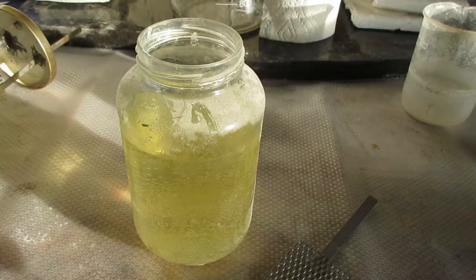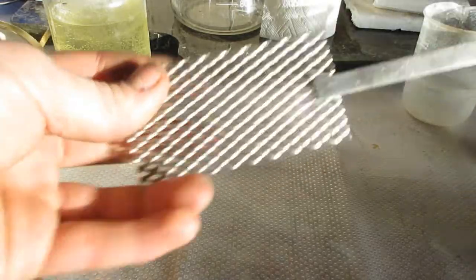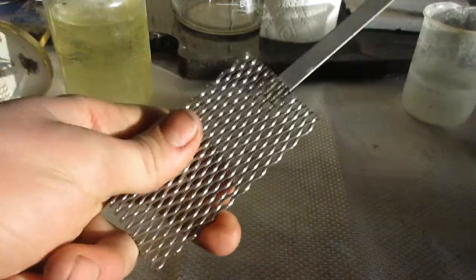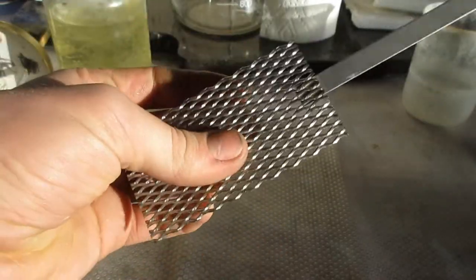And of course, if you're really unsure, you can do all the classic tests, like taking a magnet to it, seeing if it sticks or not, or grinding it. NerdRage has a video on that. I'd recommend doing all the tests you can to make sure it's fake or not.